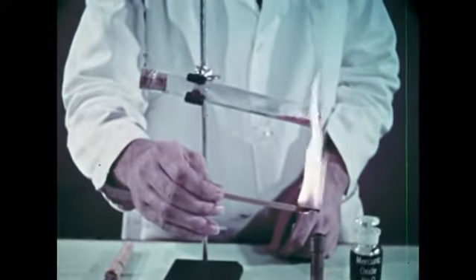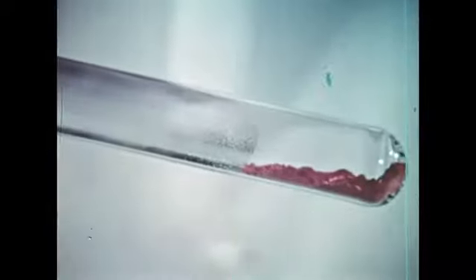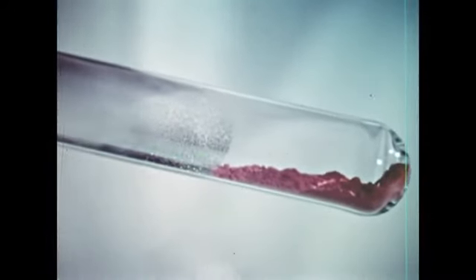You've seen the mercury droplets form. Now we'll test for the oxygen. Of course, the combustion test converts the oxygen into water and carbon dioxide. If, instead of using up the oxygen by testing, we had heated the tube again at a lower temperature over a period of time, we could get the mercury and oxygen to recombine.